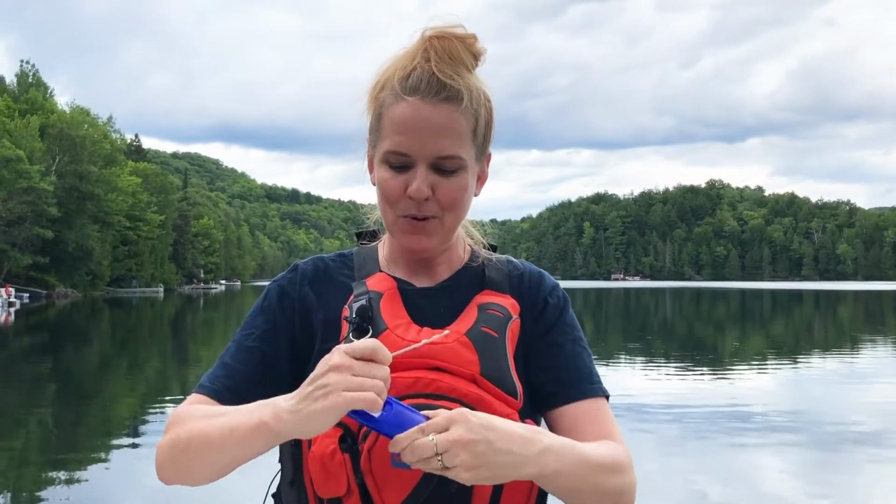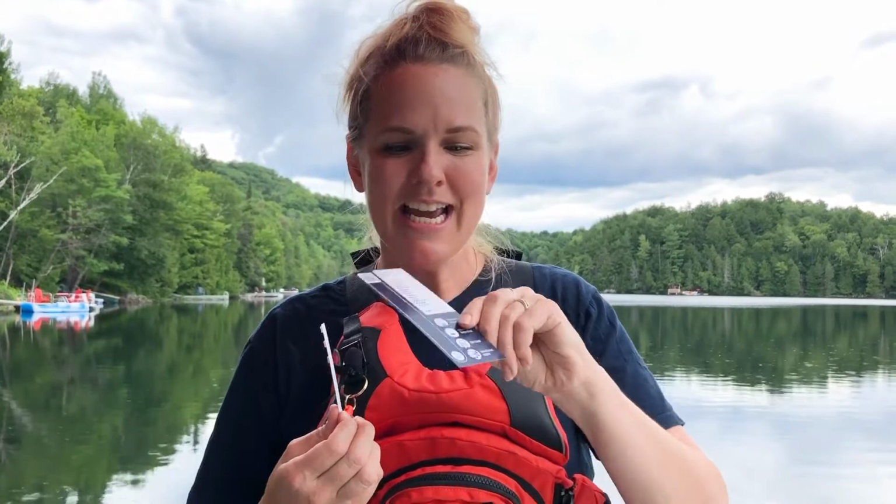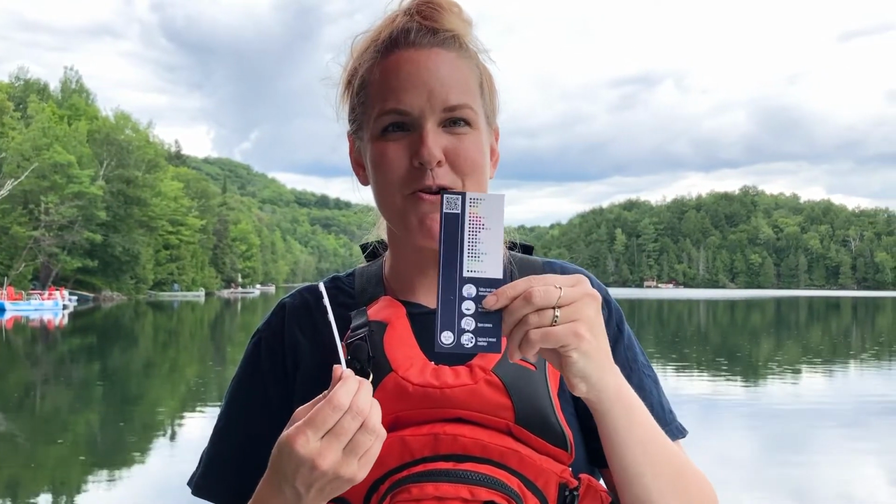We also include a recycling container. We put our used test strips in there, and at the end of the season, use the envelope that we give you to mail your used test strips back to us for recycling. If you're part of our machine learning study, you can also take a photo of your test strip on our reference card, and this is going to help us interpret the colors using machine learning.